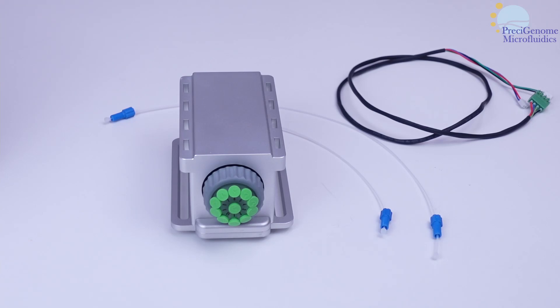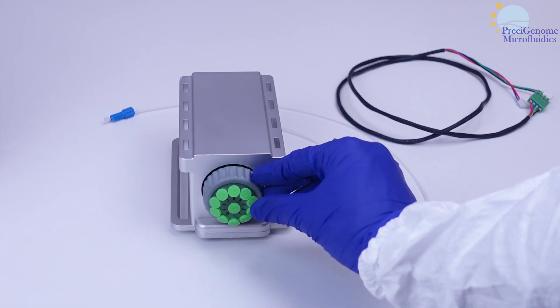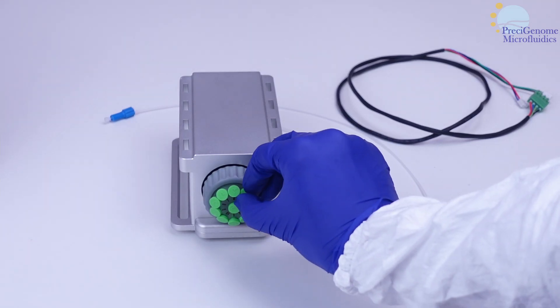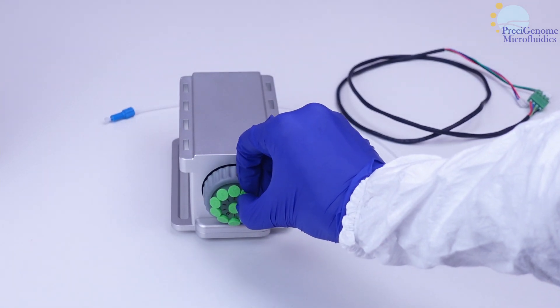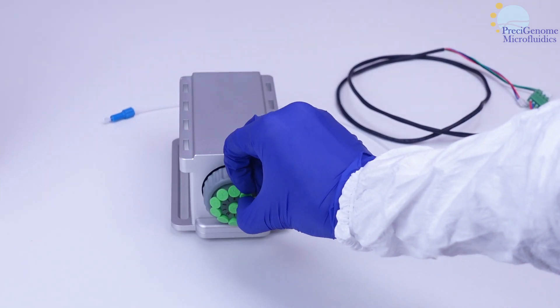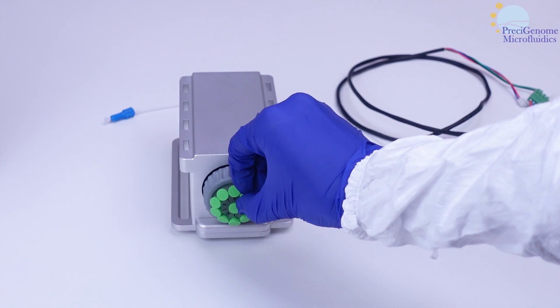In this video, we will look at two different types of rotary valves and how to integrate them into your setup.